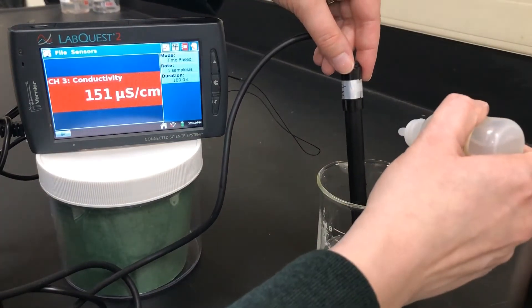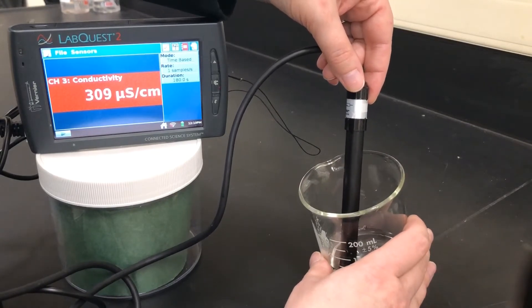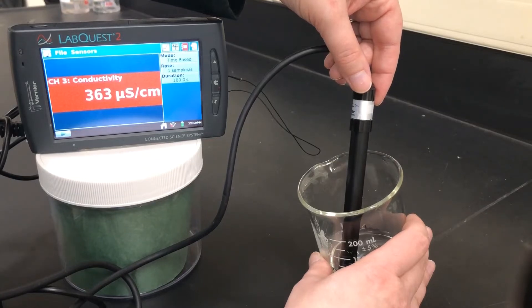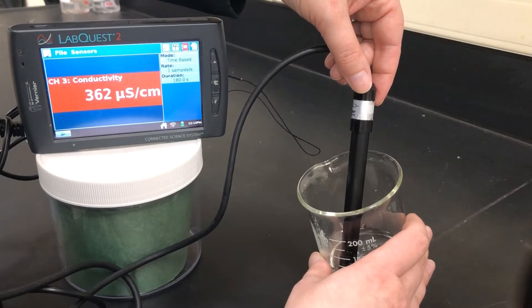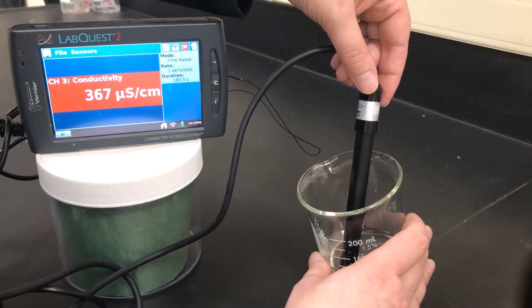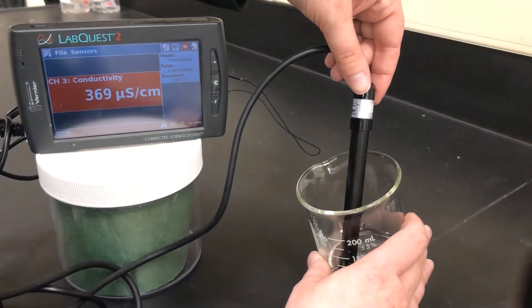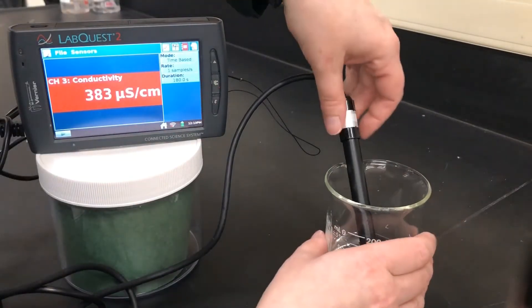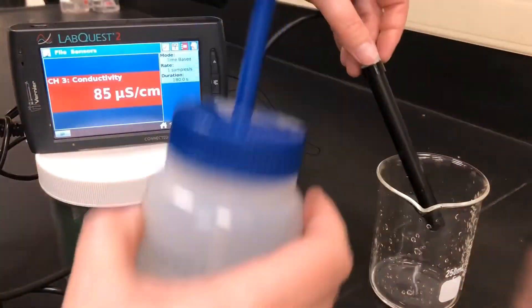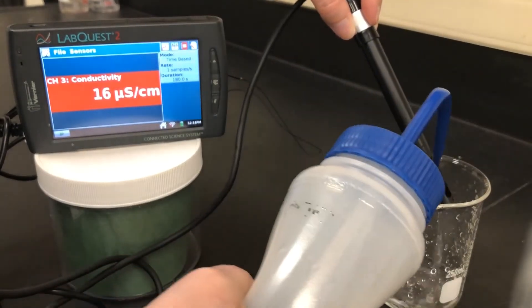Now our final third drop of zinc chloride. Give it a swirl and let the number stabilize. 367 to 368 for our final drop of zinc chloride — at three drops we have approximately 368. This is safe to go down the sink. I'm going to use my waste beaker to rinse off the conductivity probe again, to make sure there's no contamination between trials.